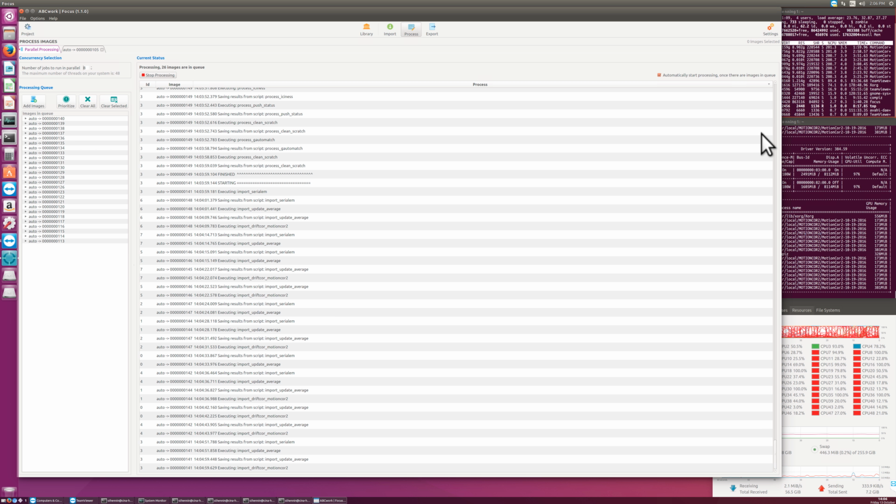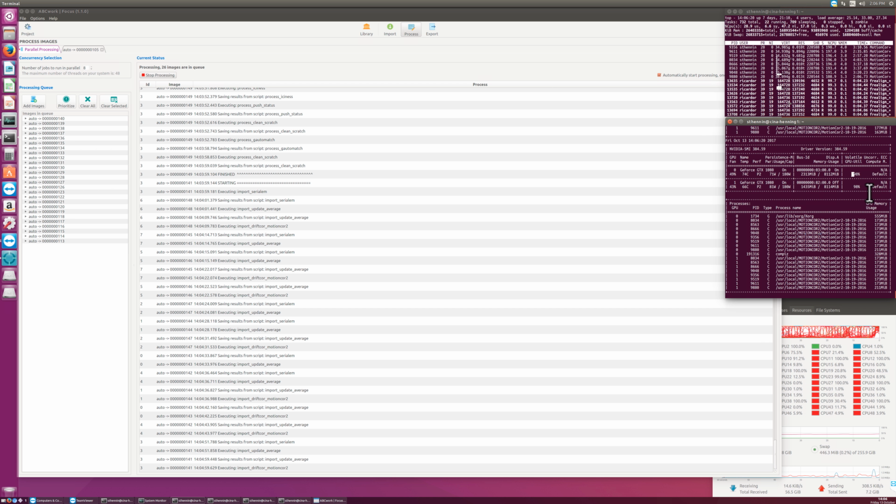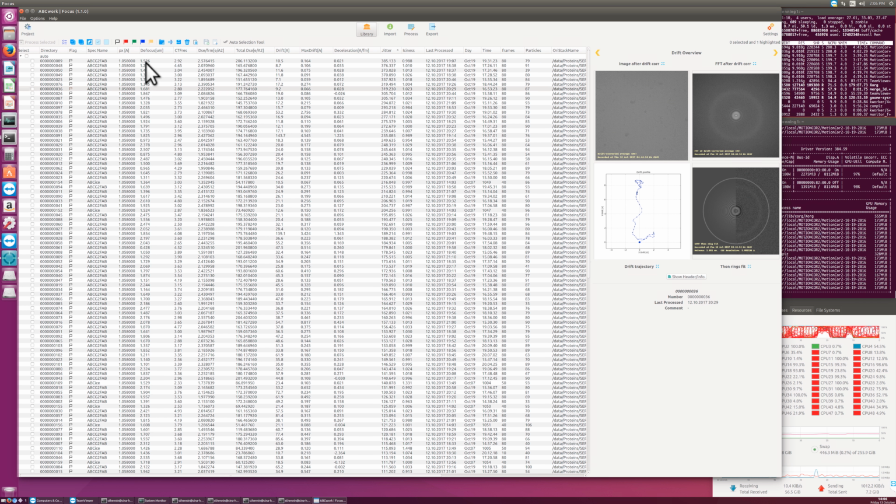some are here processing. I'm running 8 at the moment in parallel, and the GPUs are nicely loaded with 99% GPU utilization. That's good. Temperature and all that is still under control, and there's not too much swap in memory. So the batch queues are still running with 8 in parallel, and they all end up here in the library.